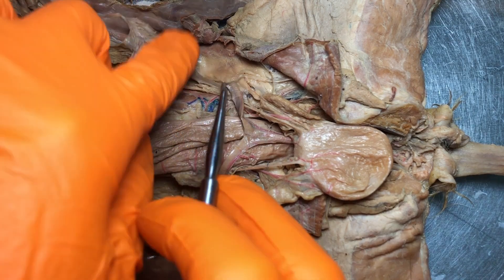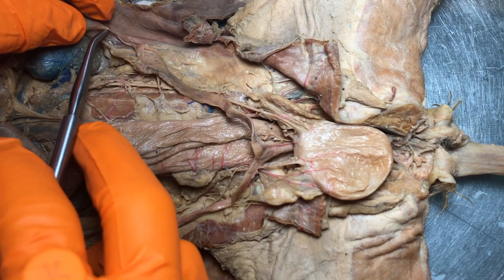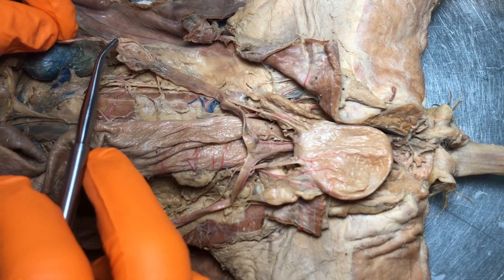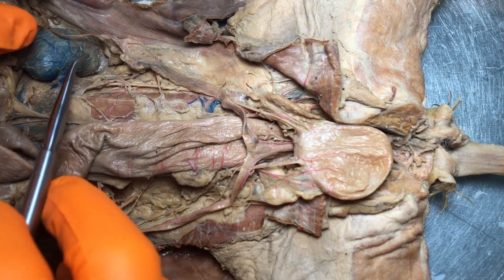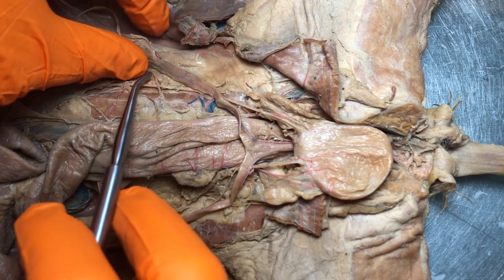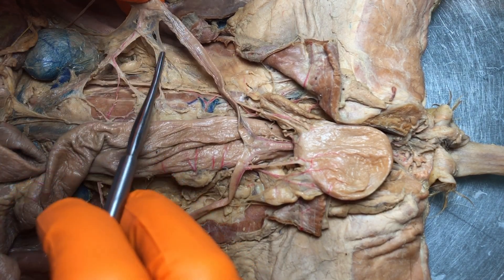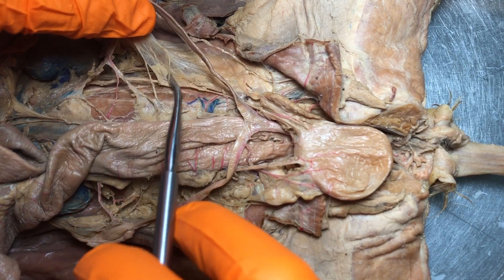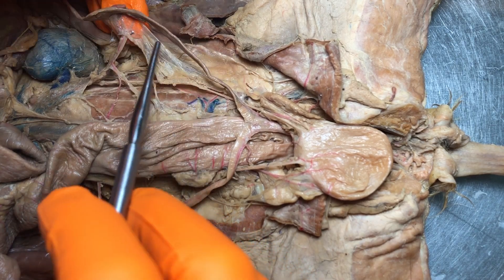This little ligament right here is the suspensory ligament. A way I like to think of this is it kind of suspends the ovary. We have another ligament in this area and that's the broad ligament. This tissue here, if we think about what connects to the uterine horns, that's the broad ligament.